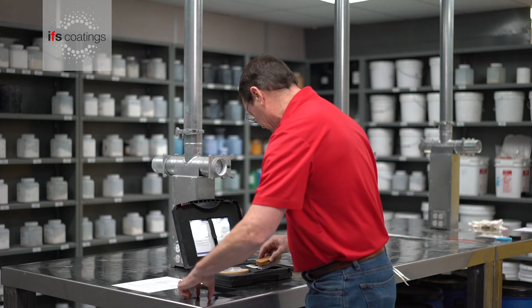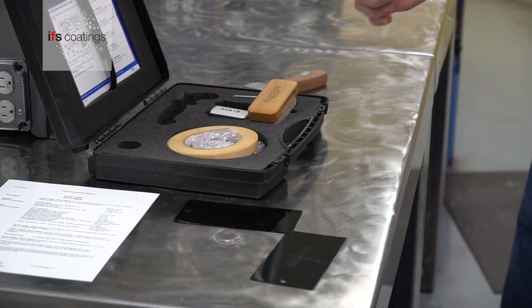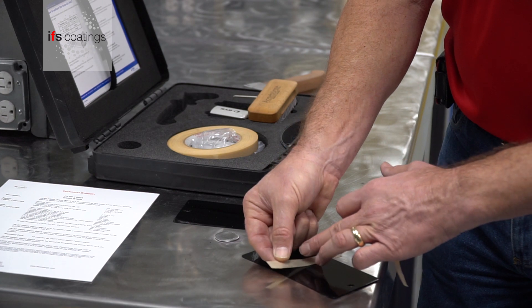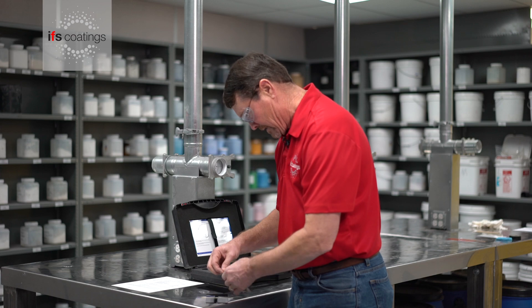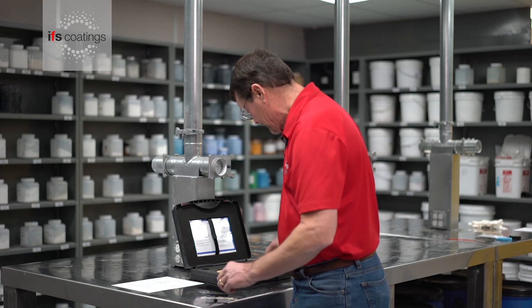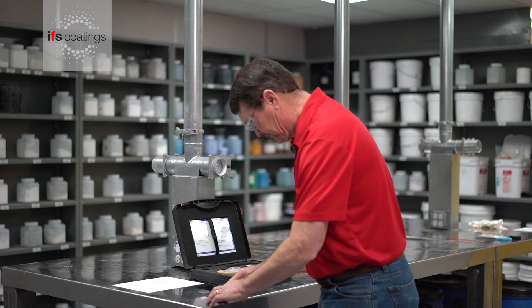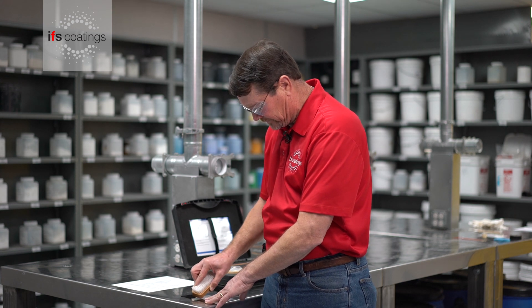Brush off any of the residue. We're using a little bit thinner tape today — normally it is a little wider — but for expediency we'll use this particular one. We will apply the tape over the substrate, rub it on, and remove as many air bubbles as possible.